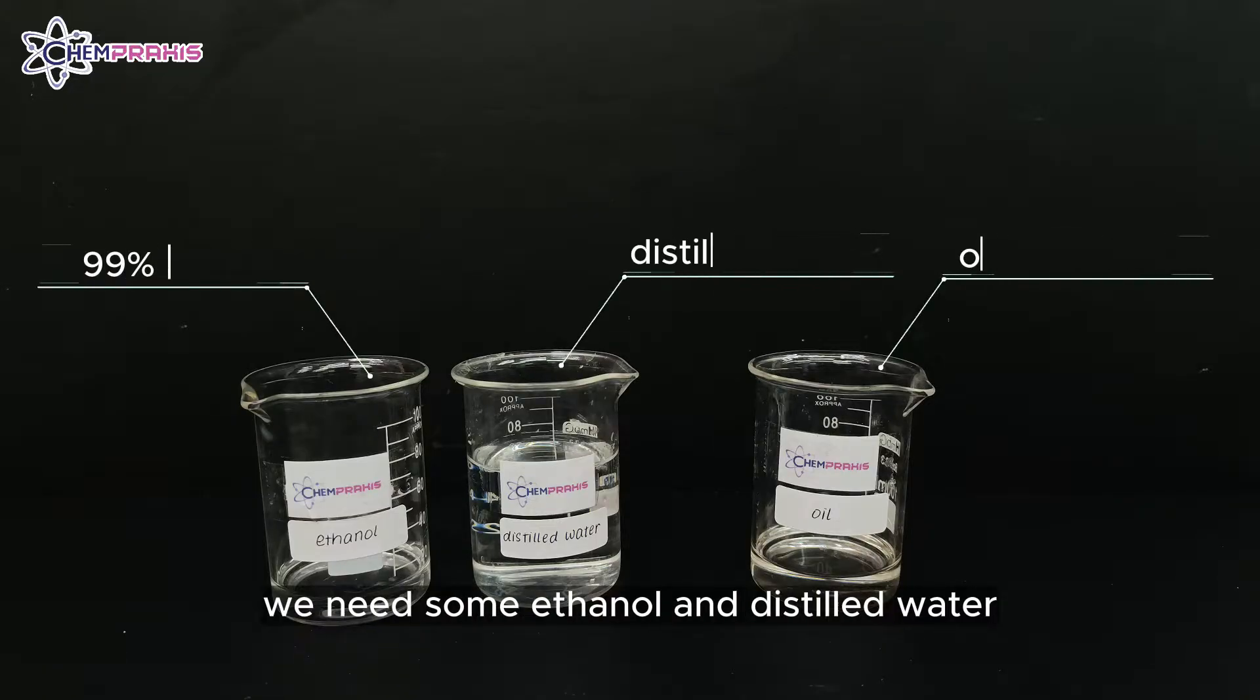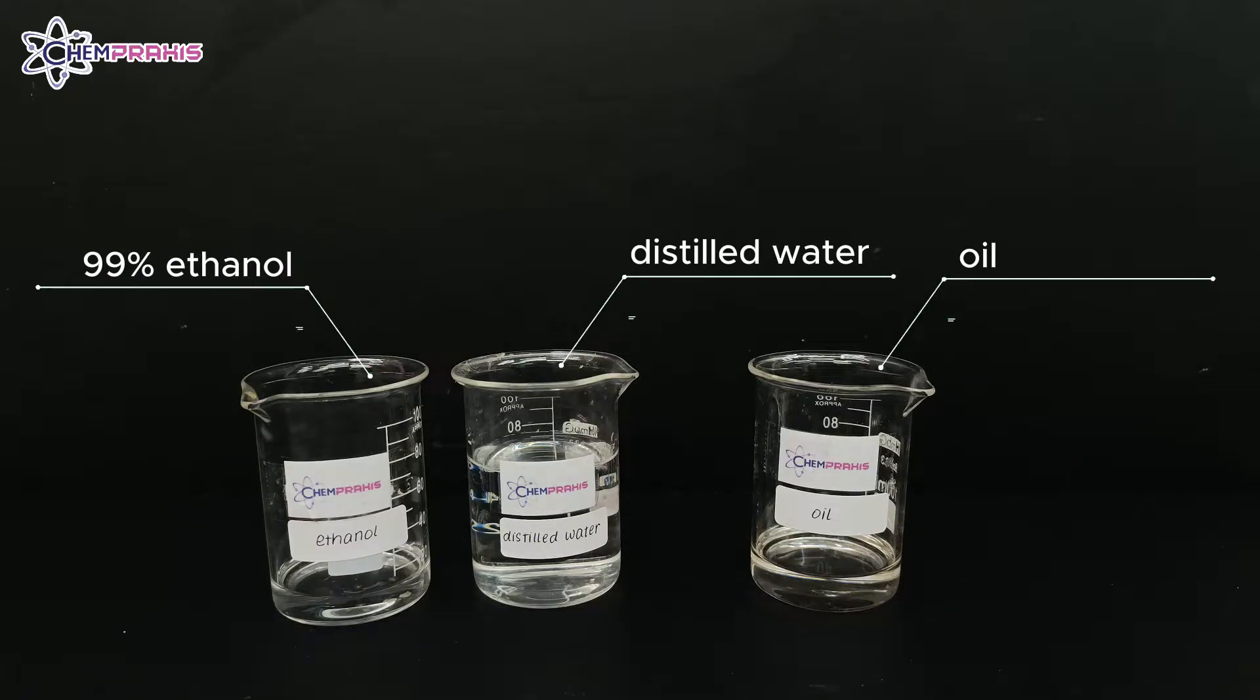To carry out the test, we need some ethanol and distilled water. We'll be carrying out the test on oil which contains lipids.